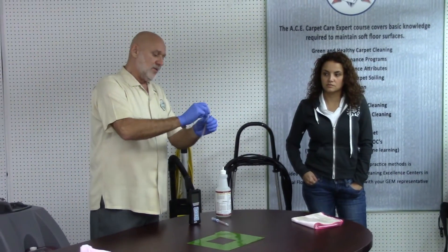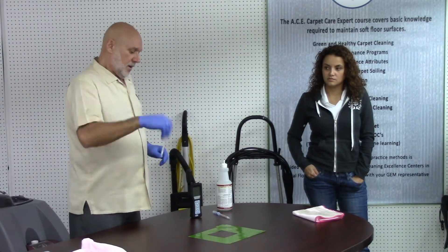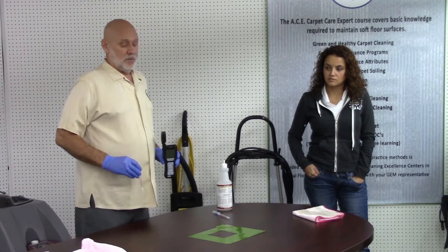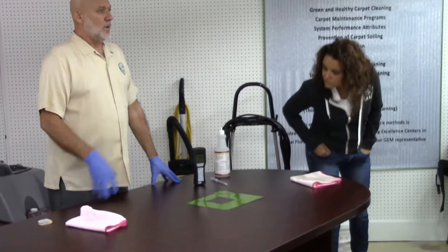I'm going to break the vial and shake it. Now, the whole question is: I can visually see that I cleaned the surface, but what I can't see is disinfection. This is my point — this is what I've been telling you all day. You've been asking: what is clean? Well, that's cleaning. But I can't see anything — so did I clean here? Yes. But what is cleaning?